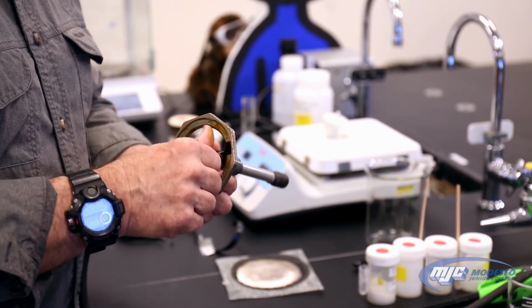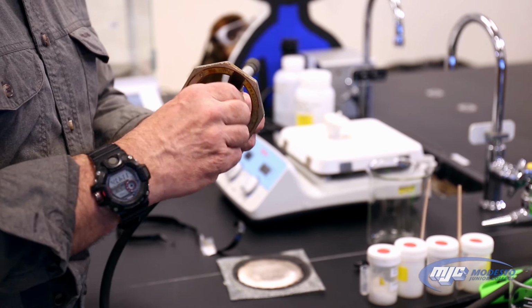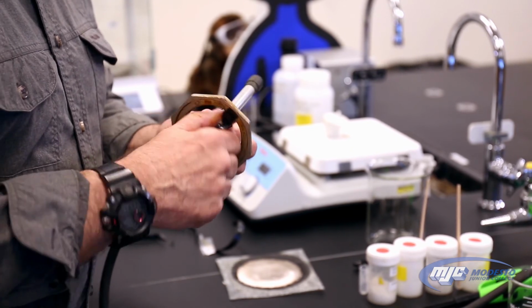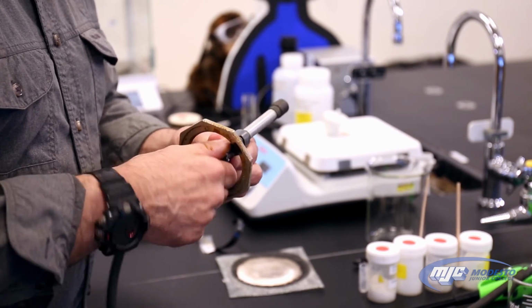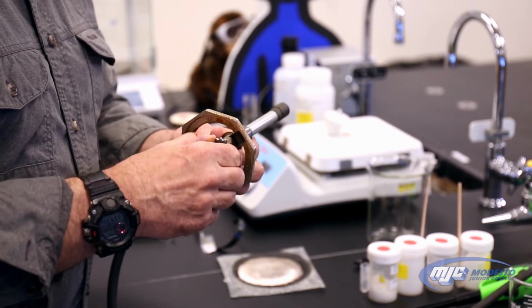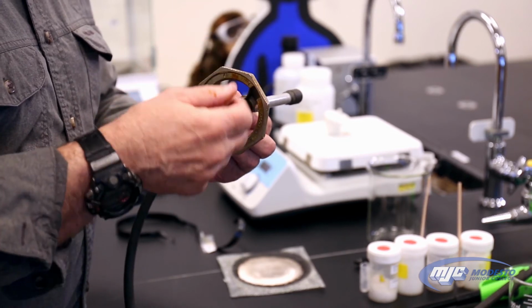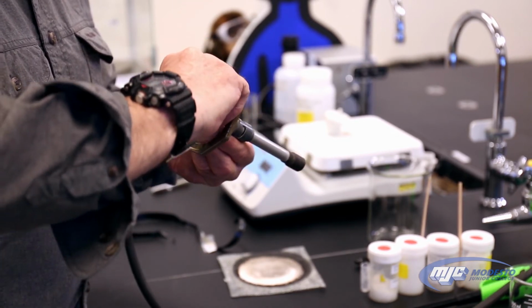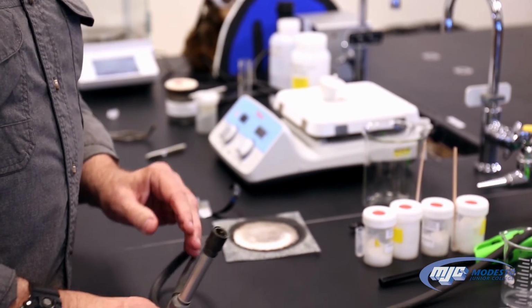So, to avoid that, when you first get your Bunsen burner, you're going to take that knurled handle, turn it in all the way till it's closed. We really don't need it backed out much to get a good flame. So once it hits the end, we're going to open it one turn, about 360 degrees. About like that. And then we'll adjust it once we light the flame.